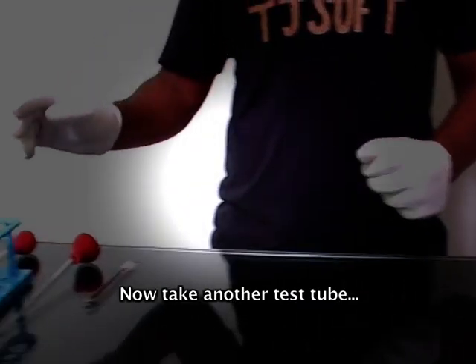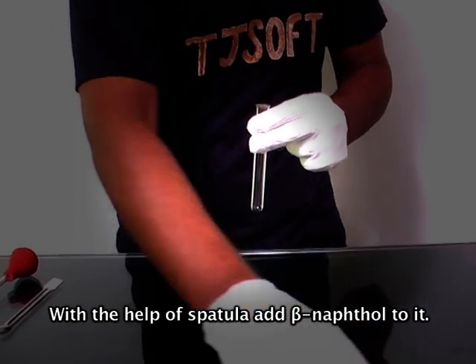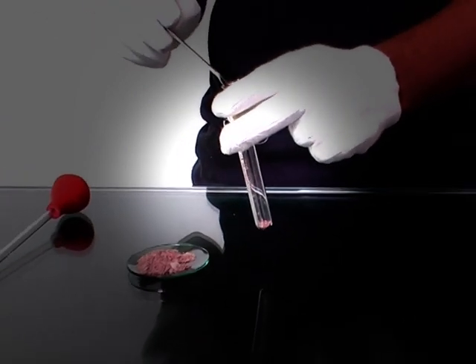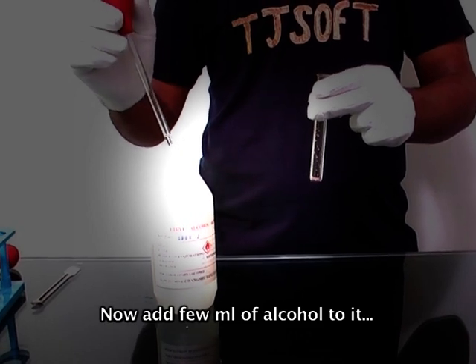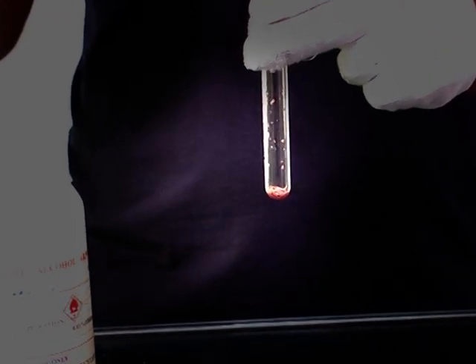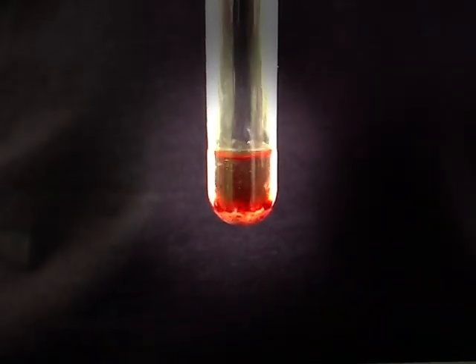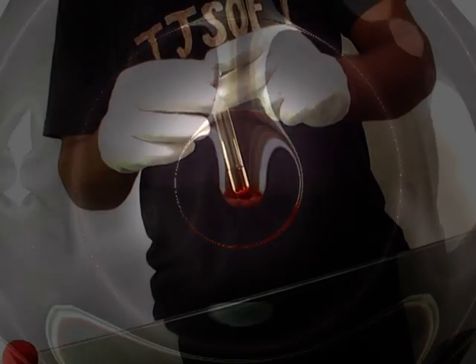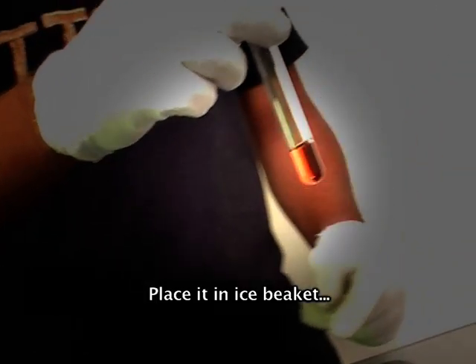Now take another test tube. With the help of a spatula, add beta-naphthol to it. Now add a few ml of alcohol to it, and shake it well. Place it in an ice beaker.